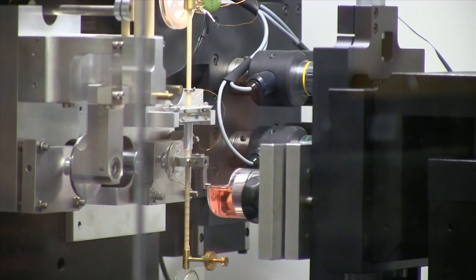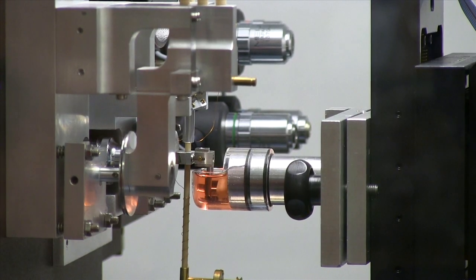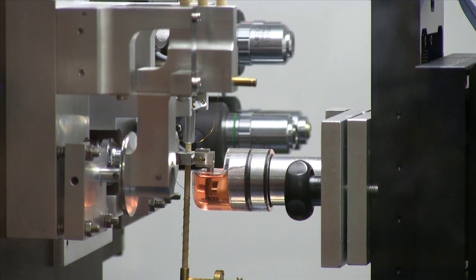I have to determine how far the pendulum swings back before you apply the load to drive it into the material. And now it's swung back and then you'll see the pendulum just swung forward.